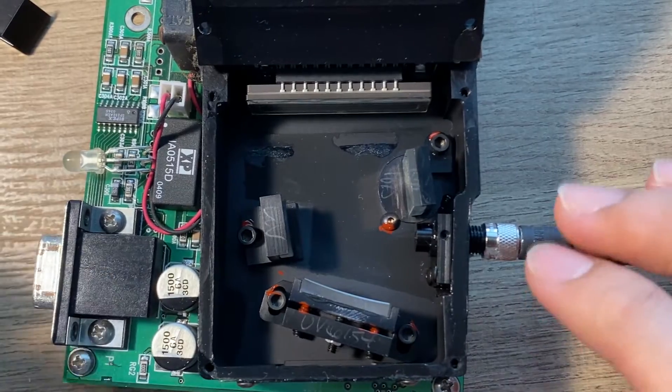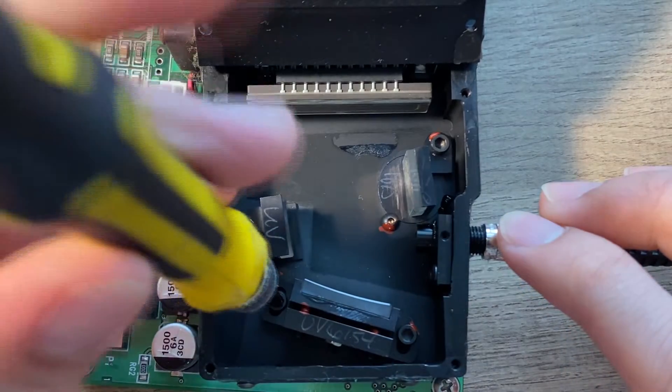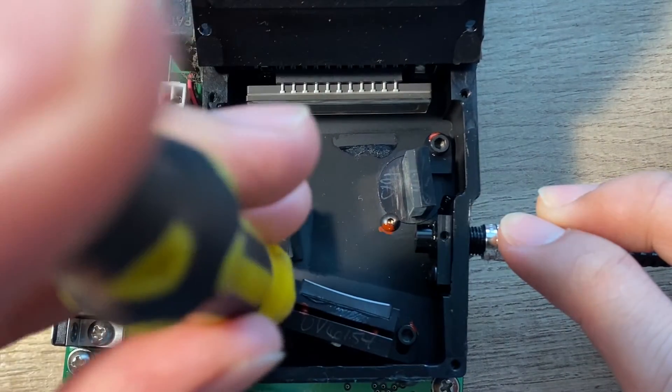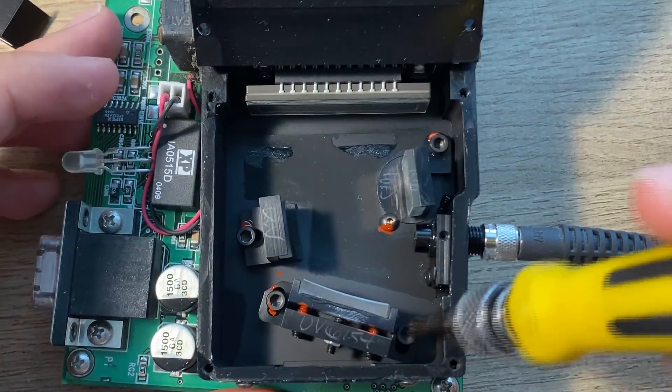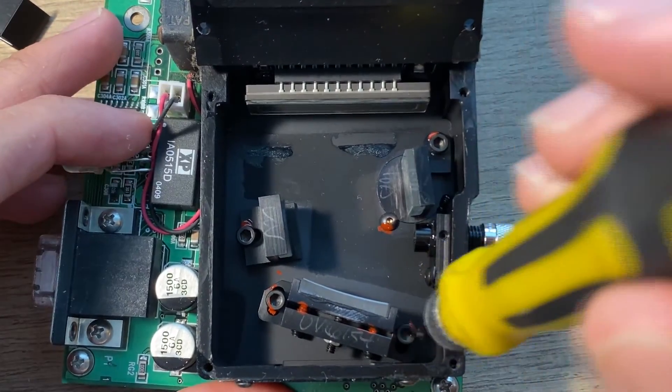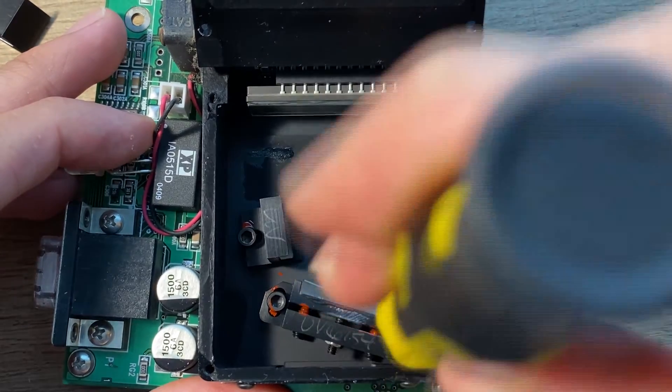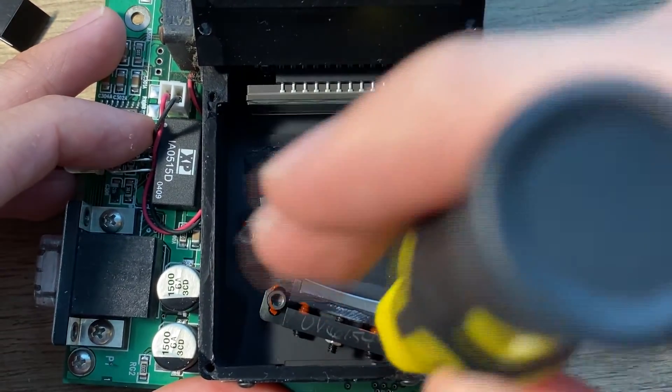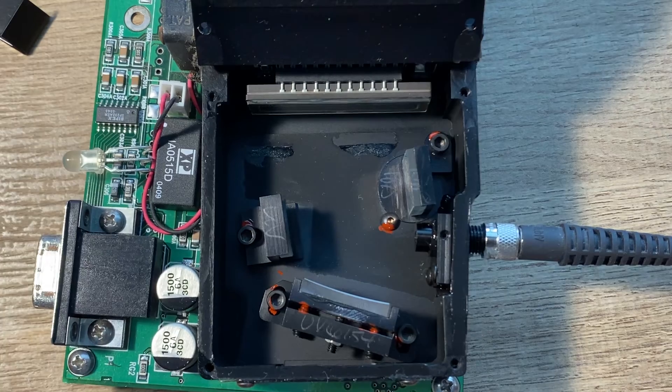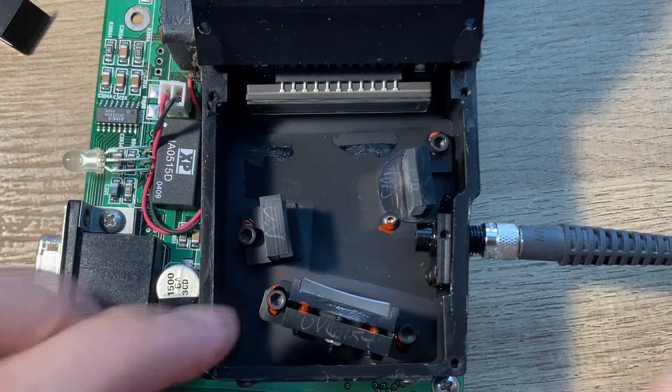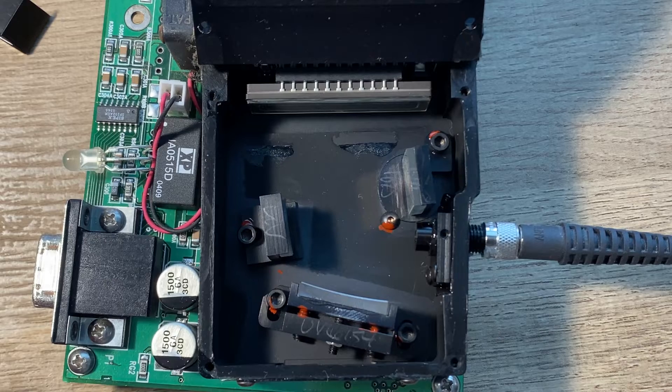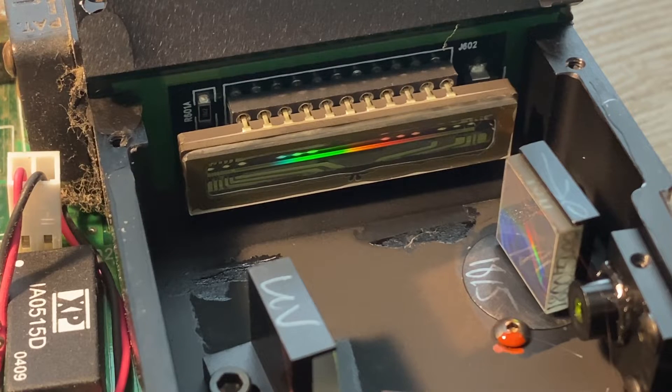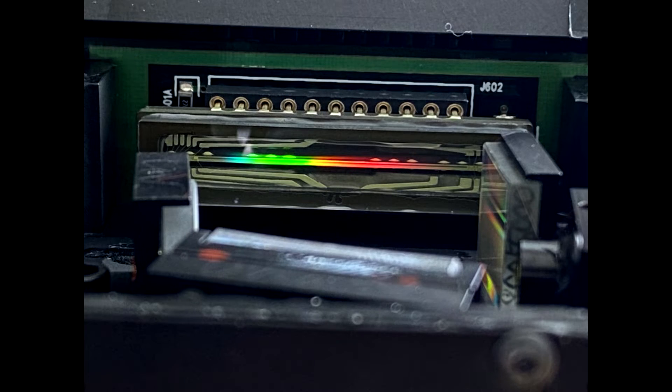To fix this, I reorientated the final stage mirror by rotating the mirror counter-clockwise. I then tested it again using the white light and we can see the broadband is centered compared to the previous setup.